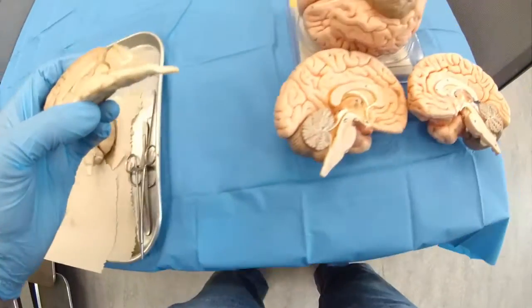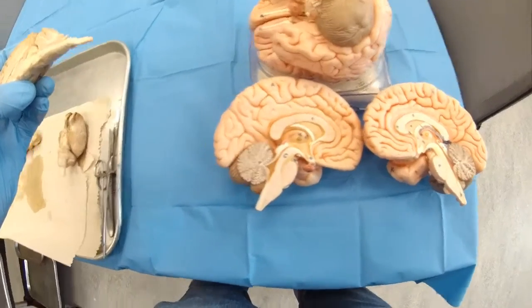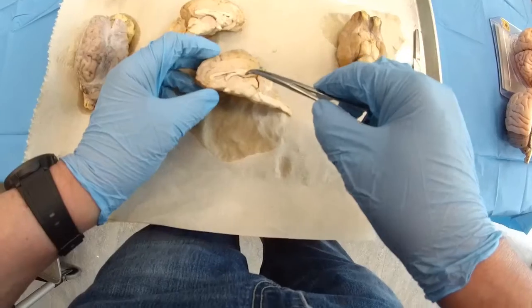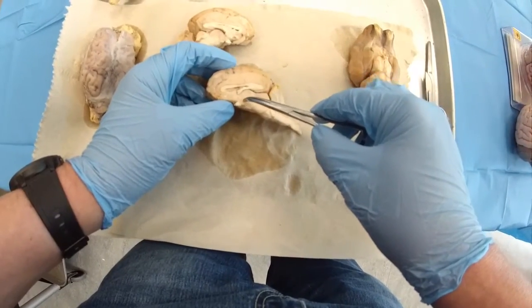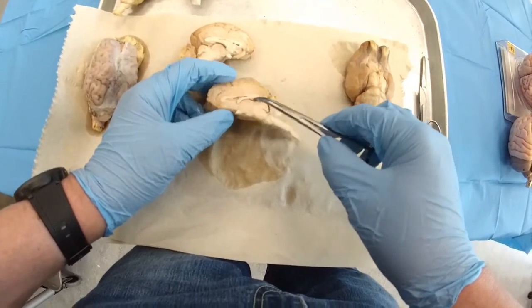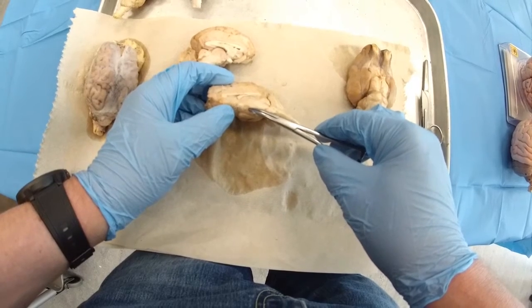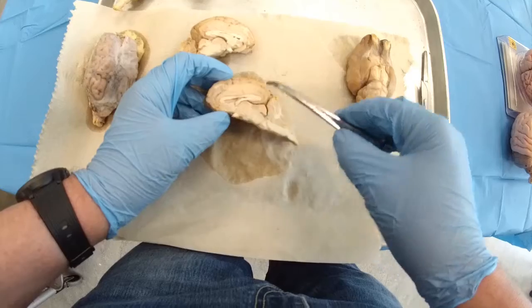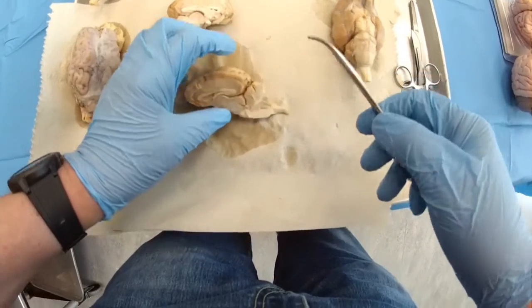Unfortunately here, no, they don't have it here. So the pineal gland. Then if you would observe the thalamus, and on this side, this is the pituitary gland, this area will be the hypothalamus. Okay.